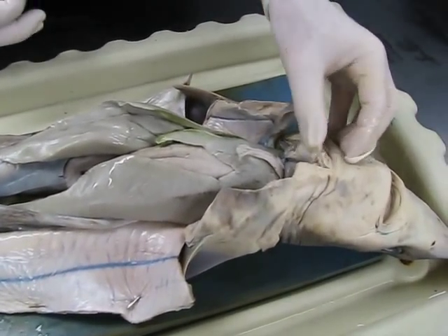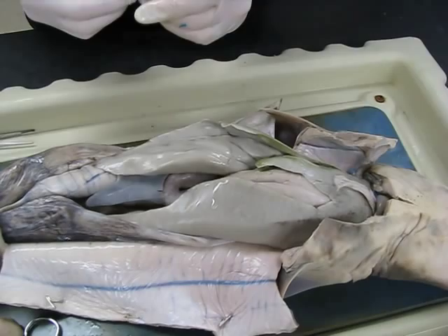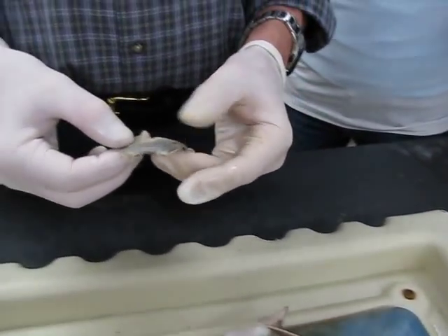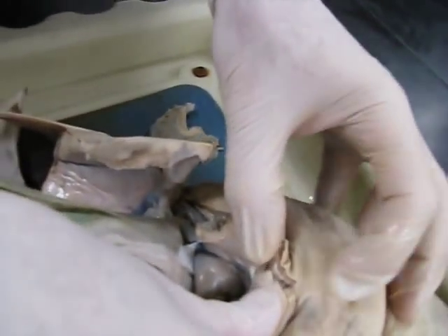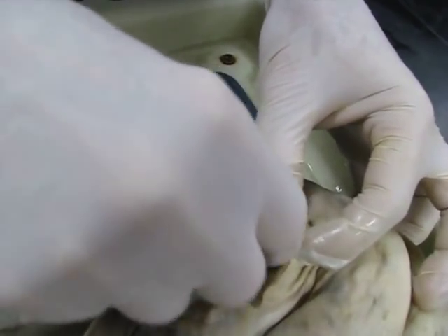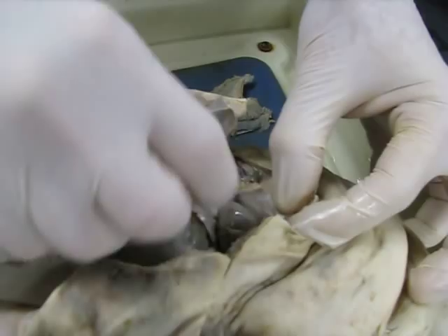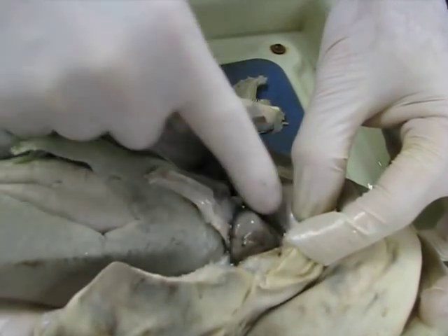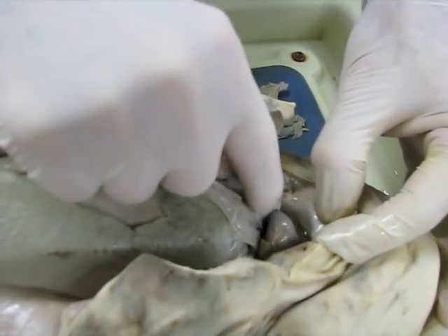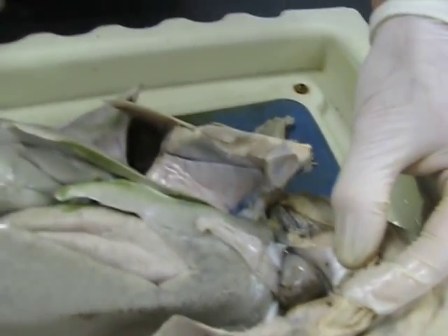You all saw the heart. You've got conus arteriosus, ventricle, and atrium. Here's the heart and the soft part of the atrium. The conus arteriosus is a section up above — it's a cone-shaped section where the heart comes to a point up there. This is the ventricle and the atrium is the darker part underneath. You can check that.